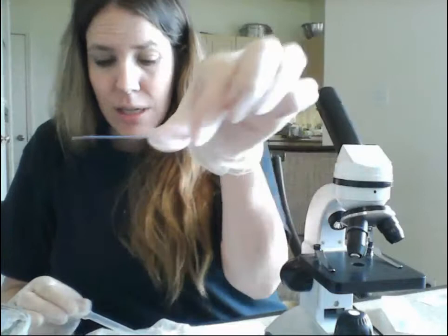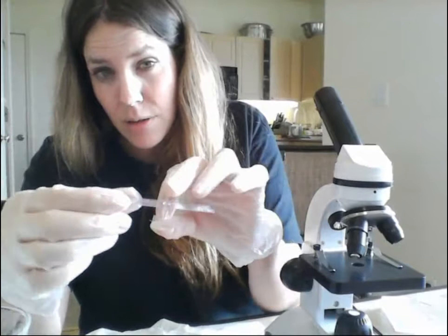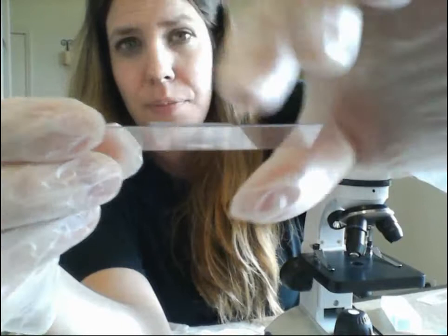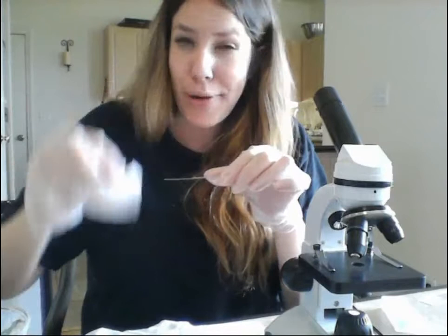Now you want to put the cover slip on. When you put a cover slip down, you don't want to just drop it — put it at an angle to eliminate the likelihood of air bubbles, then drop it and give it a little tap so it spreads out the liquid. If there's a lot of extra liquid, you can use the edges and capillary action to pull that liquid up.